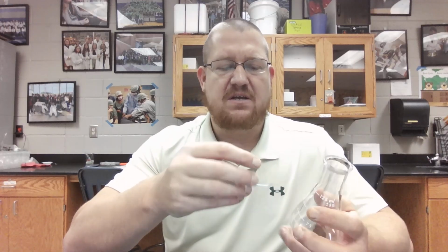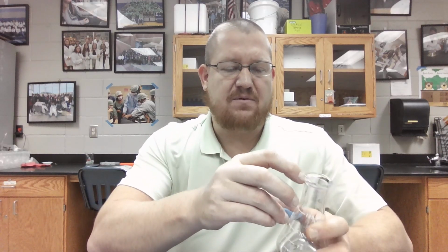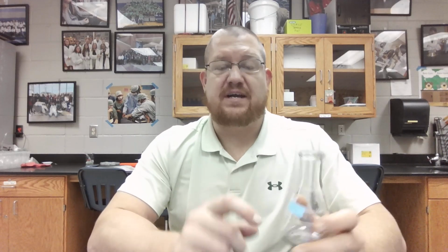So I like to pop a label right on here. There's an area that's usually on our glassware in which you could label it or make a marking with a wax pencil or something. So I just like to go ahead and put my label right across there, just as a common place. You can put it anywhere.